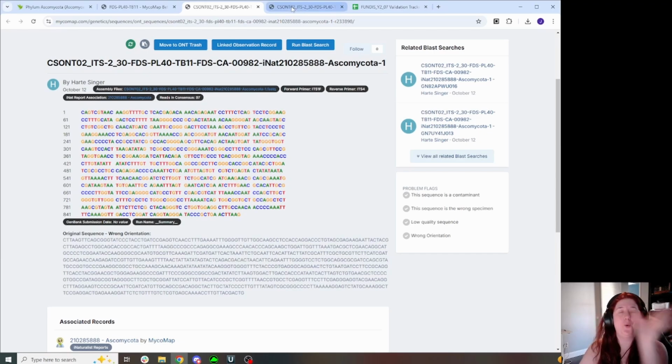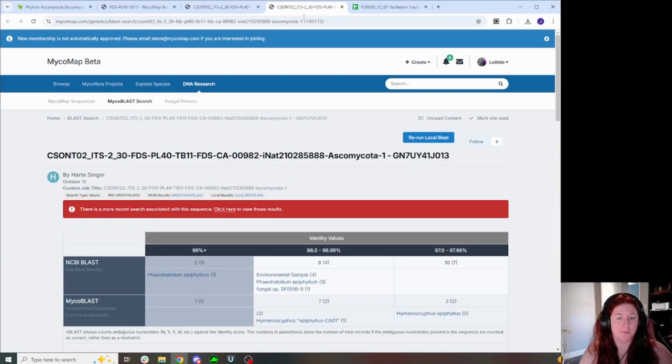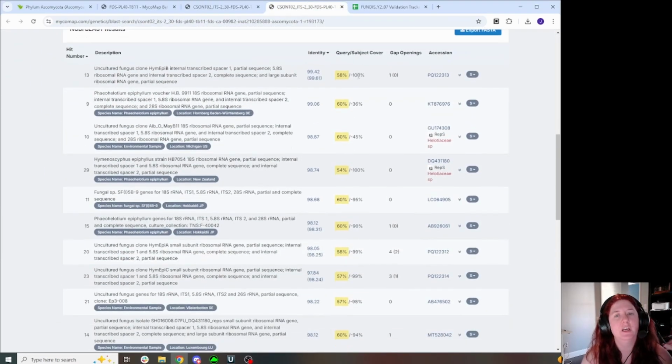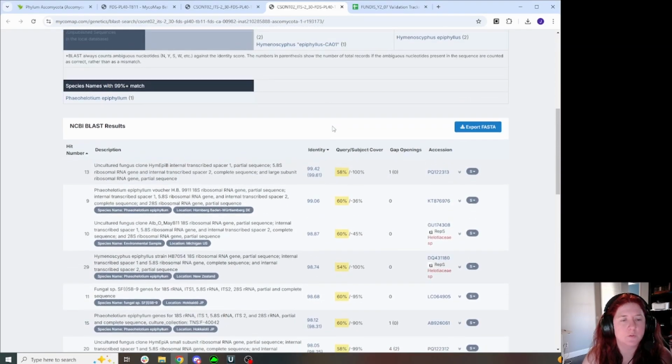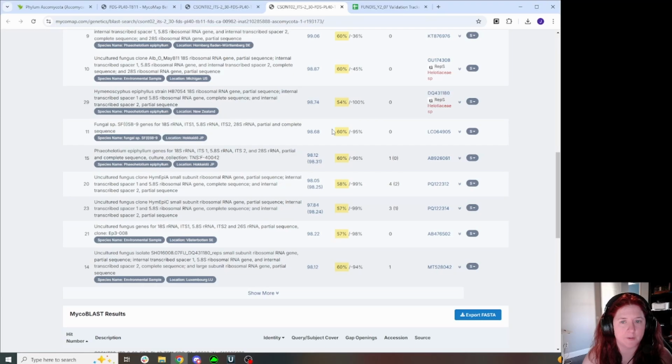So how did I know I had a group 1 intron? This doesn't look like that long of a sequence, right? But when I flip over to the BLAST page, we have really bad query cover. Sometimes when you have really bad query cover like this, it means it's a chimeric sequence. When you open the FASTQ up, you'll see one aberrant read in there that's extra crazy long for some reason.